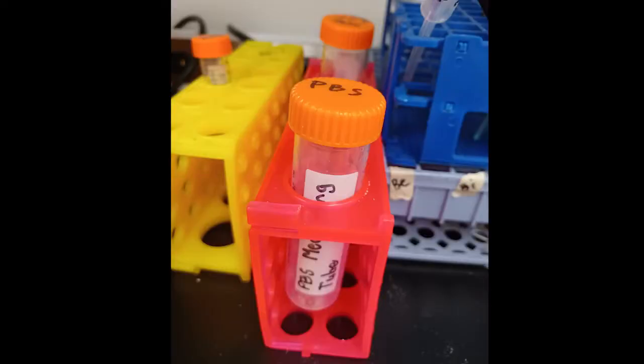A tip, if this tube runs out of PBS solution when doing rinses later, just refill it from the jug.